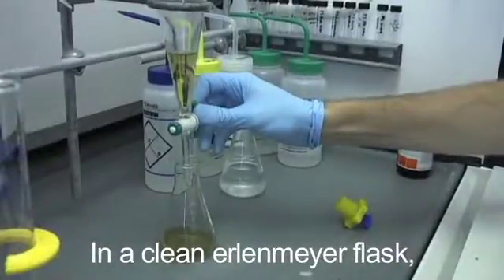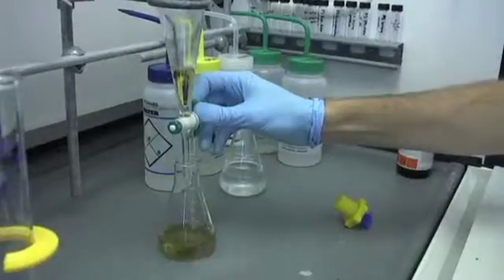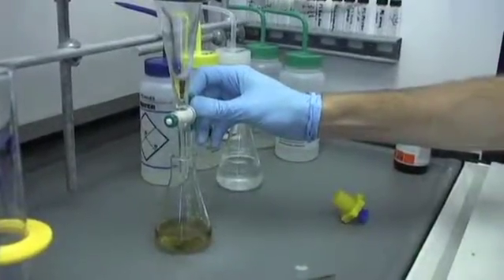In a clean Erlenmeyer flask, drain the organic solvent. I have a pretty hairy arm for a robot.